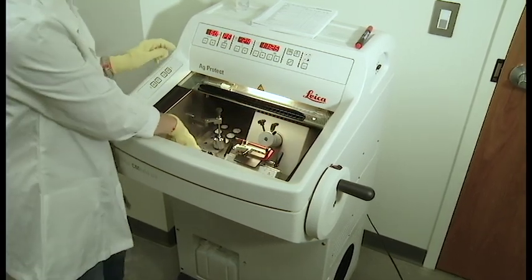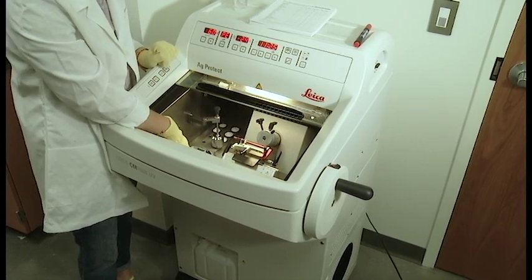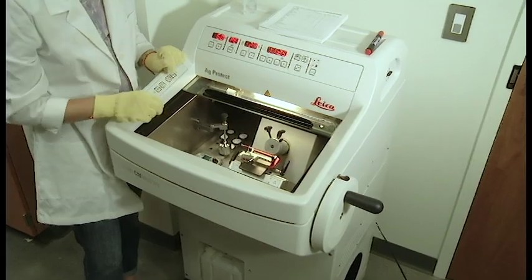This blue area here is the area that we talked about with this PE button. It's where it's going to be specifically frozen when you press that.